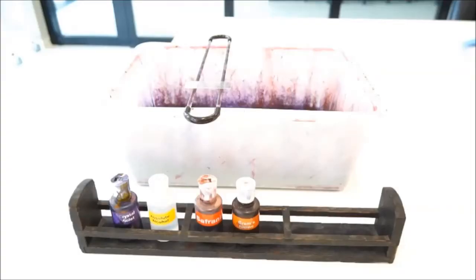So now I'll demonstrate the procedure for the Gram stain. This stain is one of the most widely used microbiological stains in the world. It's simple, it's fast, it's effective, and all of you guys will probably get it to work.